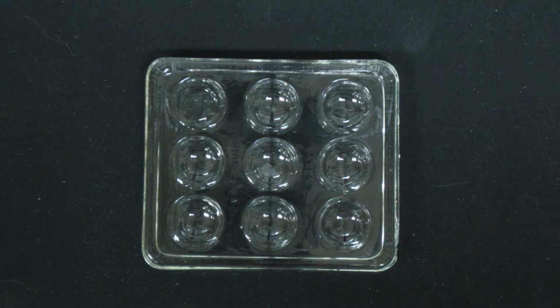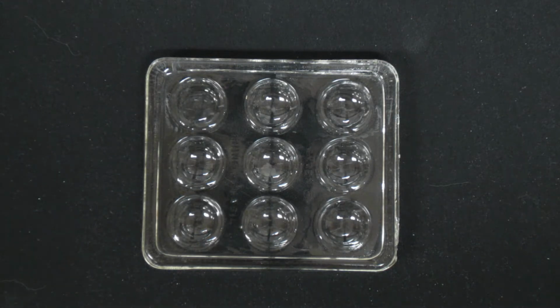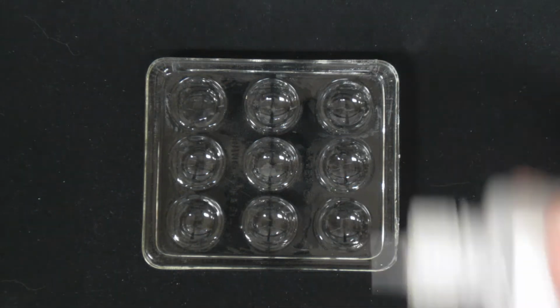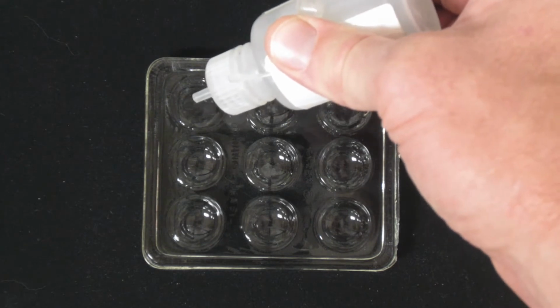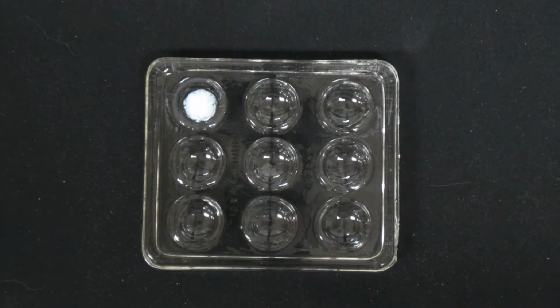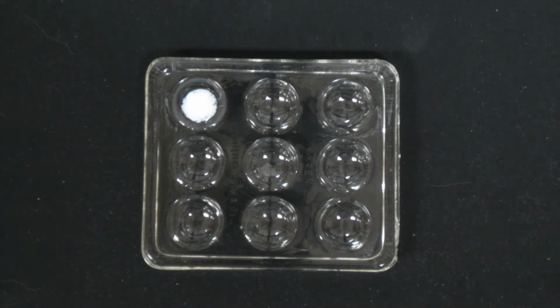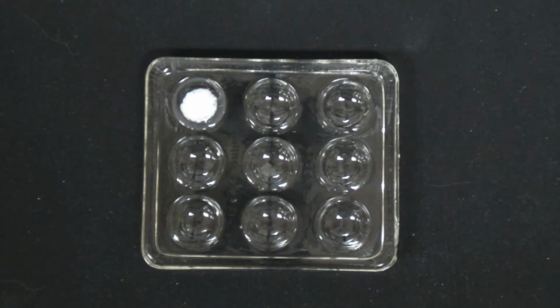That first one there is silver nitrate. And the second solution is sodium chloride. Again, it's going to be clear and colorless. And what you see is after the first drop hits, second drop a little bit more, you can see that a white solid forms for that reaction. And that's it. And what that's showing is that there's one insoluble salt that's forming in that reaction.